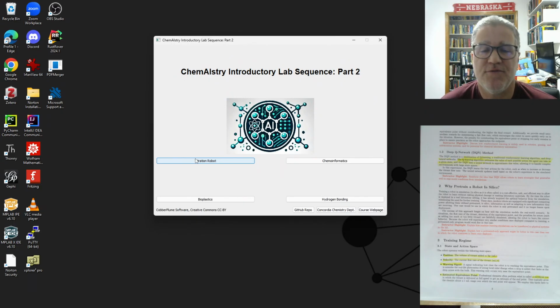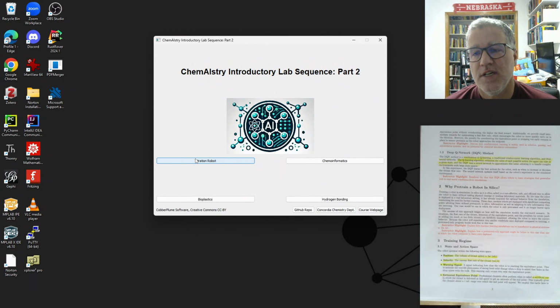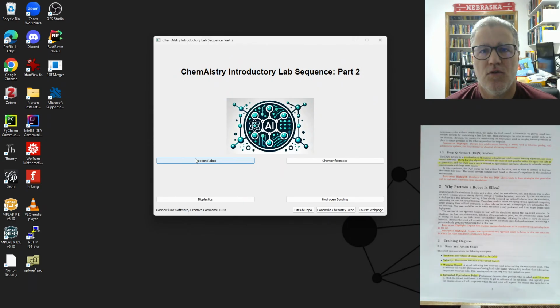But if we absolutely have no idea, then we don't know if we're going to change after 8 milliliters or 24.5 milliliters. So we do a fast one. We go past the endpoint most likely, and then we get an idea of where we should be. So the robot will also get this information of the sacrificial run. So it will know that it needs approximately 16 milliliters, for example.